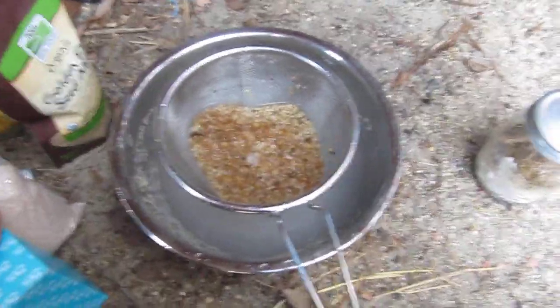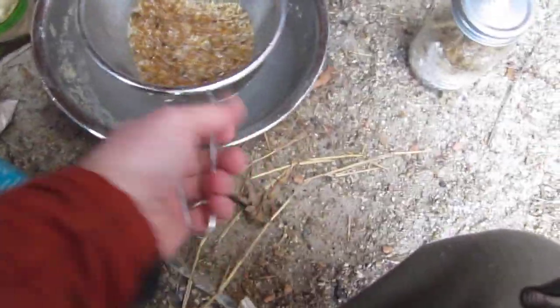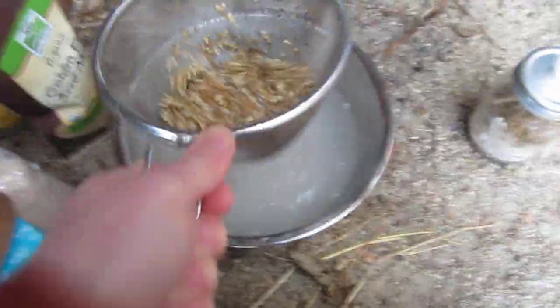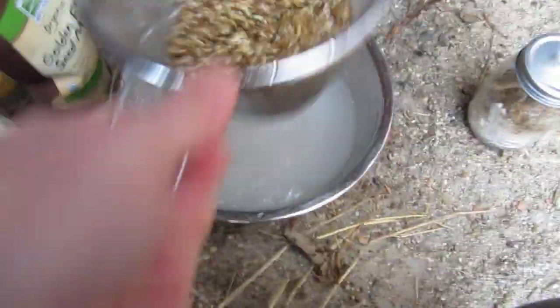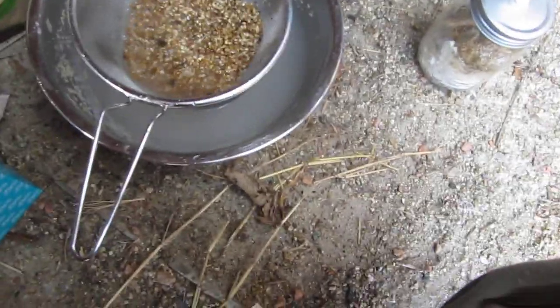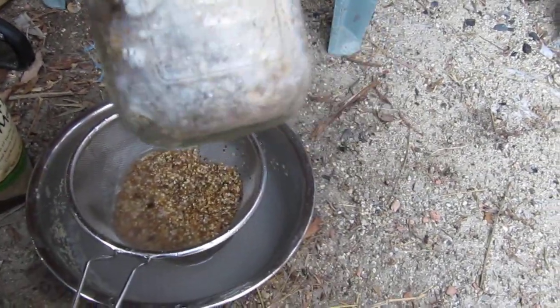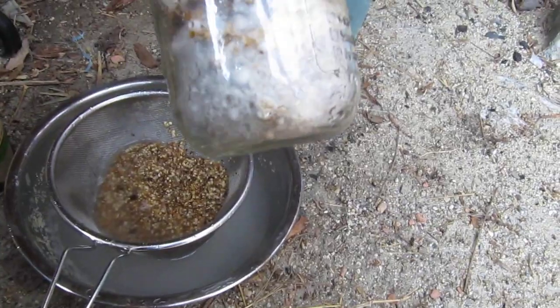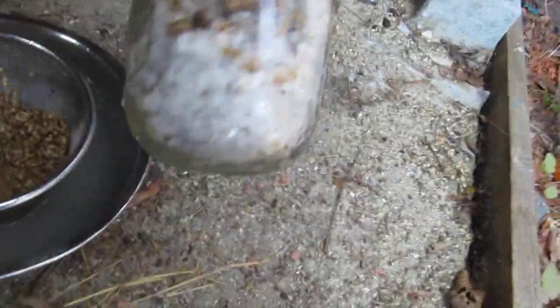This is how to make a super substrate for growing mushrooms and starting off mycelium in a vegetative state. This is my own recipe that I've been working with. I've been doing mycology for some time now — here's some lion's mane spawn I've got going. I first grew this on this substrate and now I'm transplanting it through to sawdust.